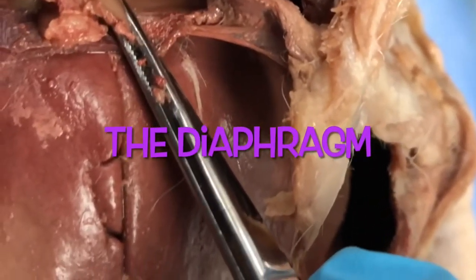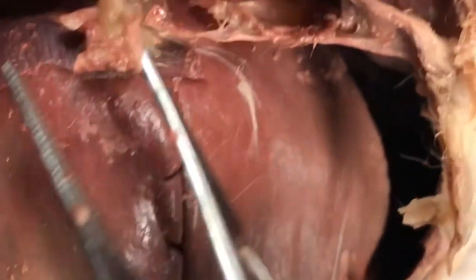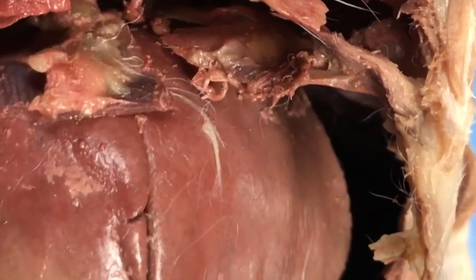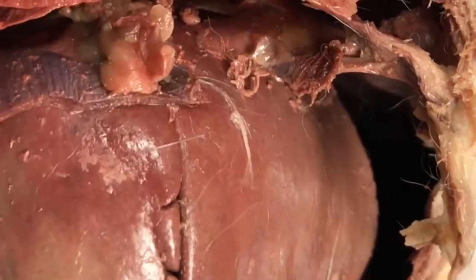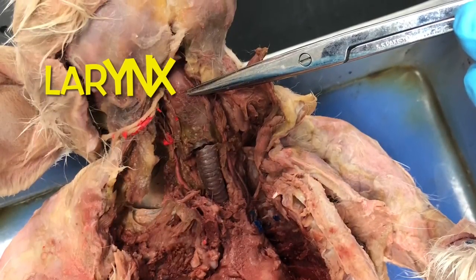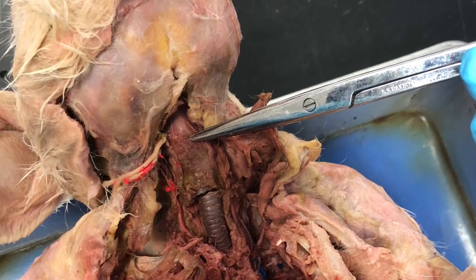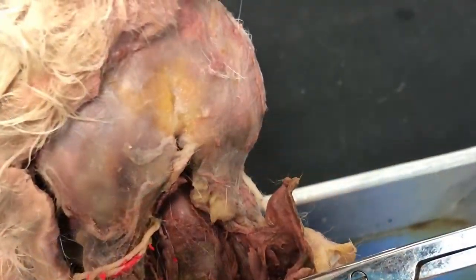And here is the diaphragm — I have it in the forceps. That is the diaphragm, the thin muscle that divides the thoracic and abdominal cavities. Here again is the larynx at the top of the trachea.